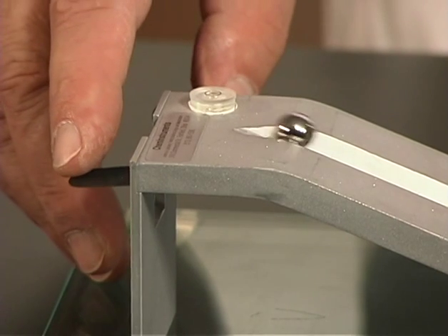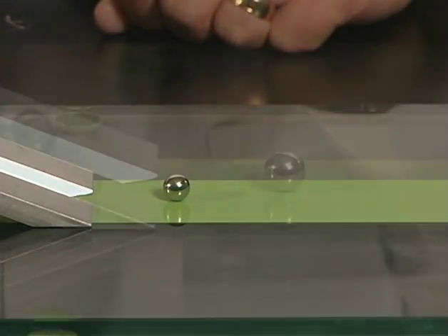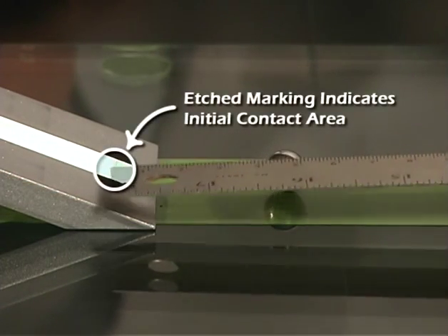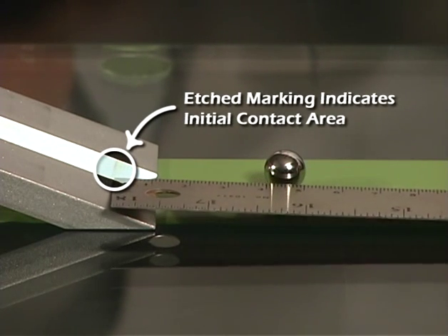Release the ball by pressing on the lever and measure the distance traveled from initial contact until it stops in millimeters or other acceptable units.